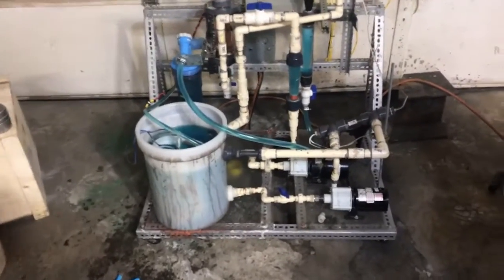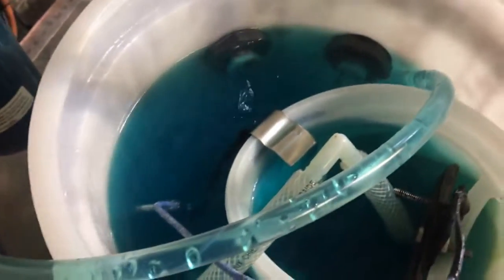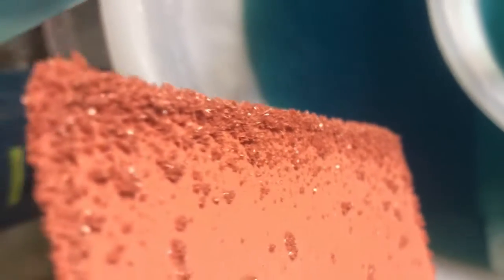So we're 46 hours in and I have hooked up this filter system. At the bottom of this cyclone I have a hose running over to a filter, because everything is getting pretty cloudy. I think I'm going to add some copper sulfate. Now we're starting to see these little spuds — these little dendrites. They are super shiny, almost like some type of gold or something. Very shiny crystals. The phone doesn't really pick it up the way I'm seeing it — I'm not seeing as much brilliance through the screen.